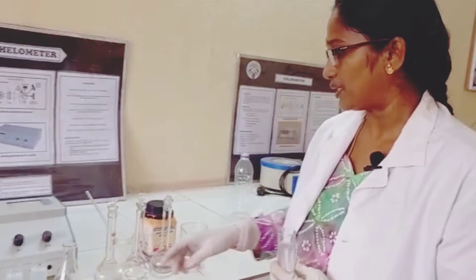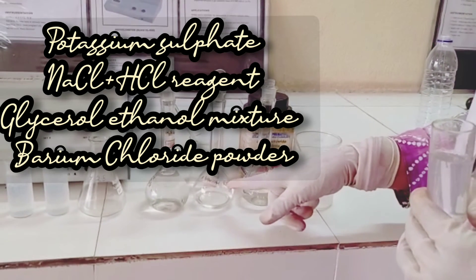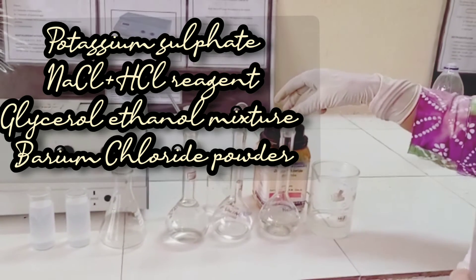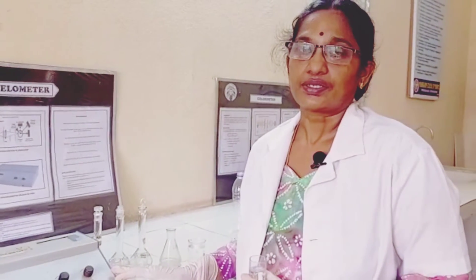We are estimating barium sulphate solution, which was prepared by taking different concentrations of potassium sulphate solution, to which we added sodium chloride HCl reagent, ethanol and glycerol mixture. To all the concentrations we added barium chloride powder, then shaken well and finally made up with distilled water to produce the required barium sulphate suspension. This method is mainly used to determine inorganic substances, especially sulphates, and is also used to detect suspended particles in treated waters, water systems, paper and pulp industry, sugar industry, etc.